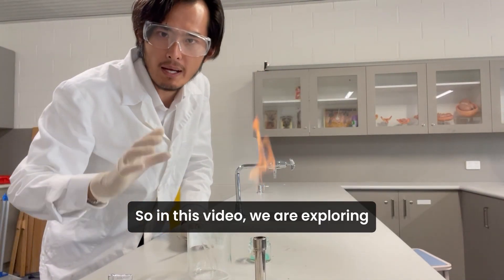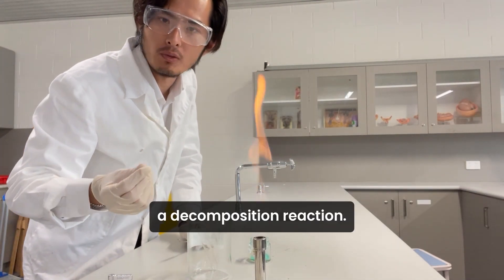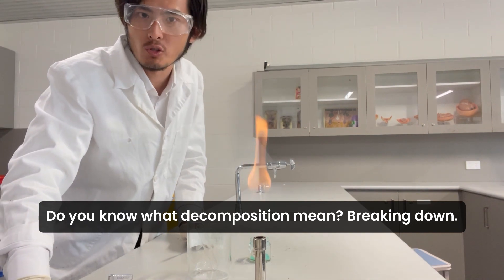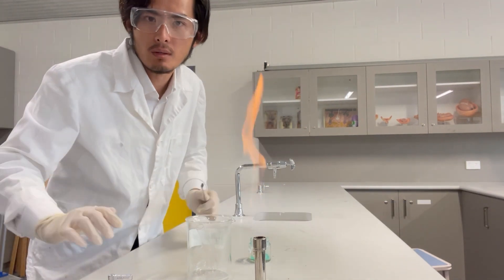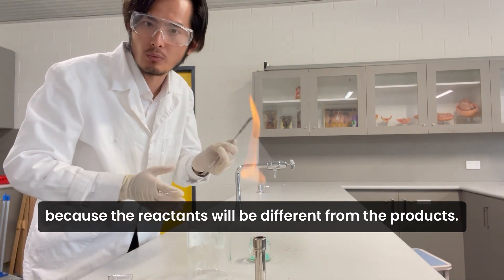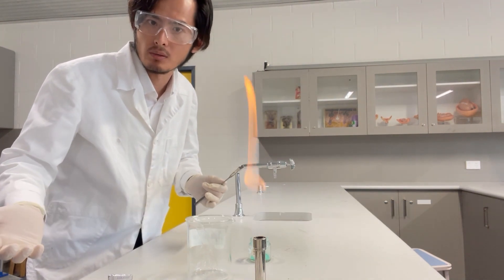In this video, we are exploring a decomposition reaction. Do you know what decomposition means? Breaking down. This is a type of chemical reaction because the reactants will be different from the products.